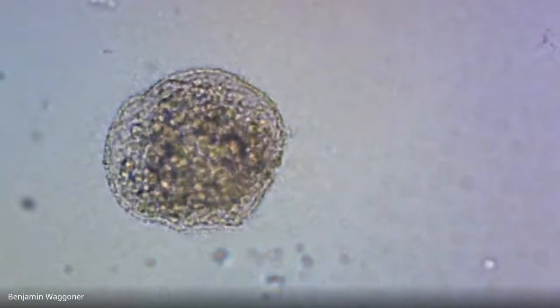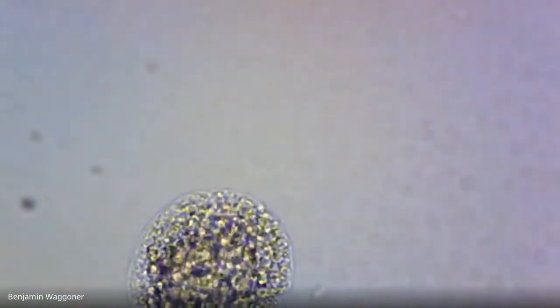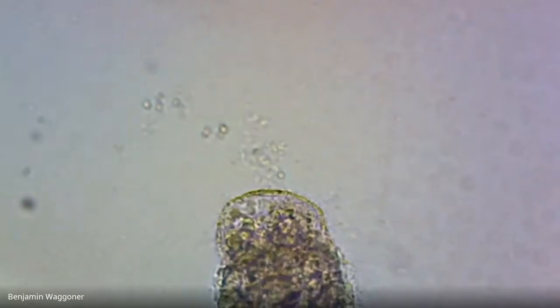And this one here just looks trashed. And that one just looks trashed. And that one looks trashed.